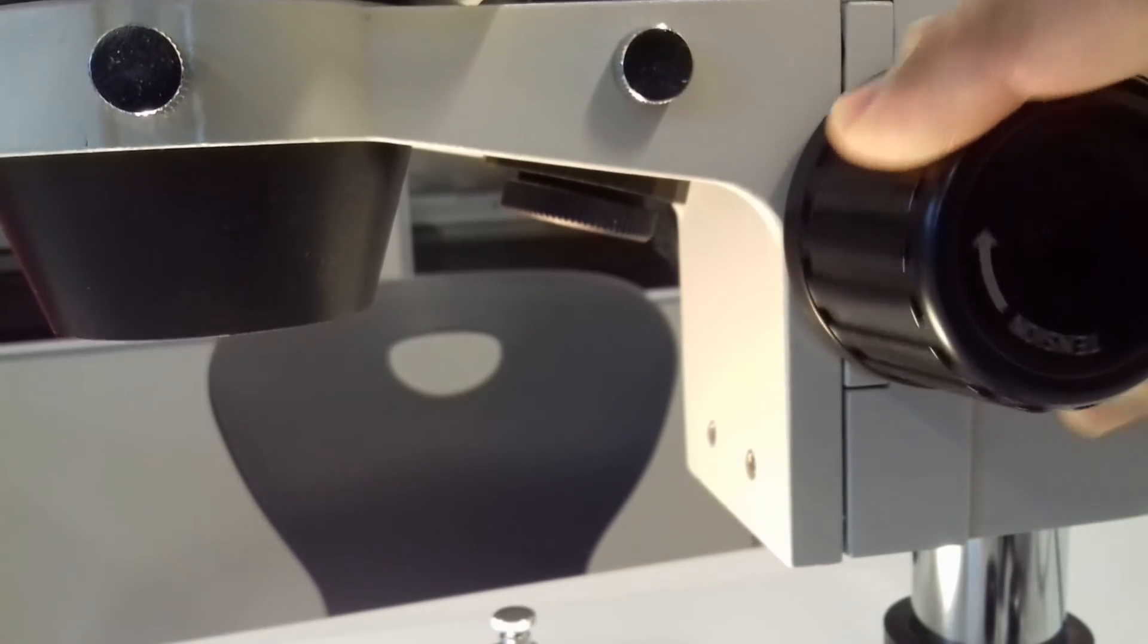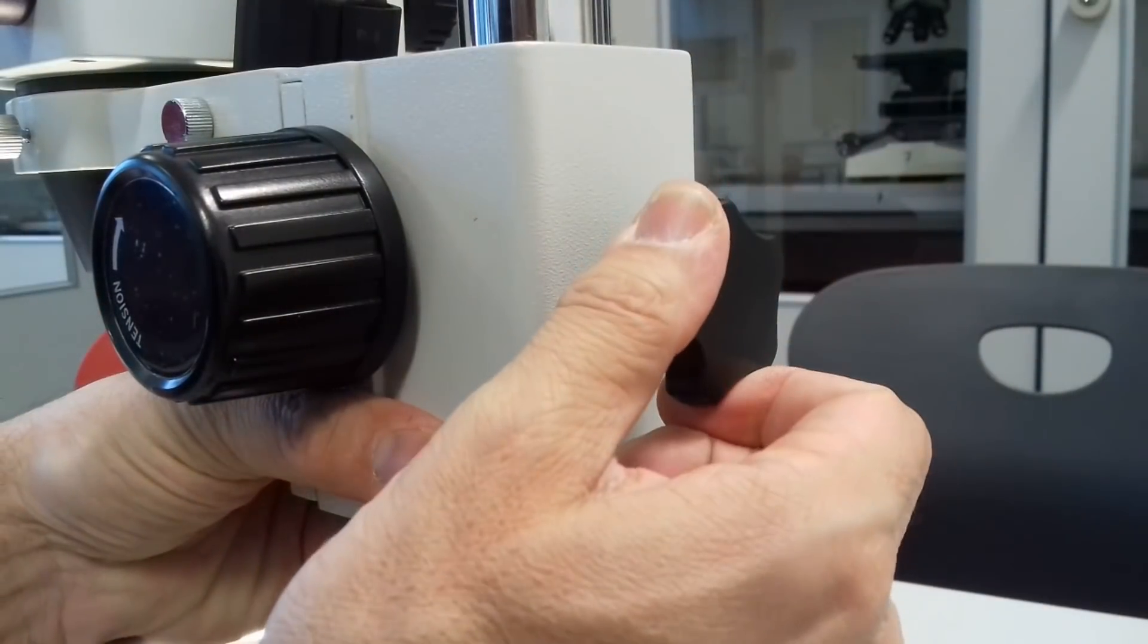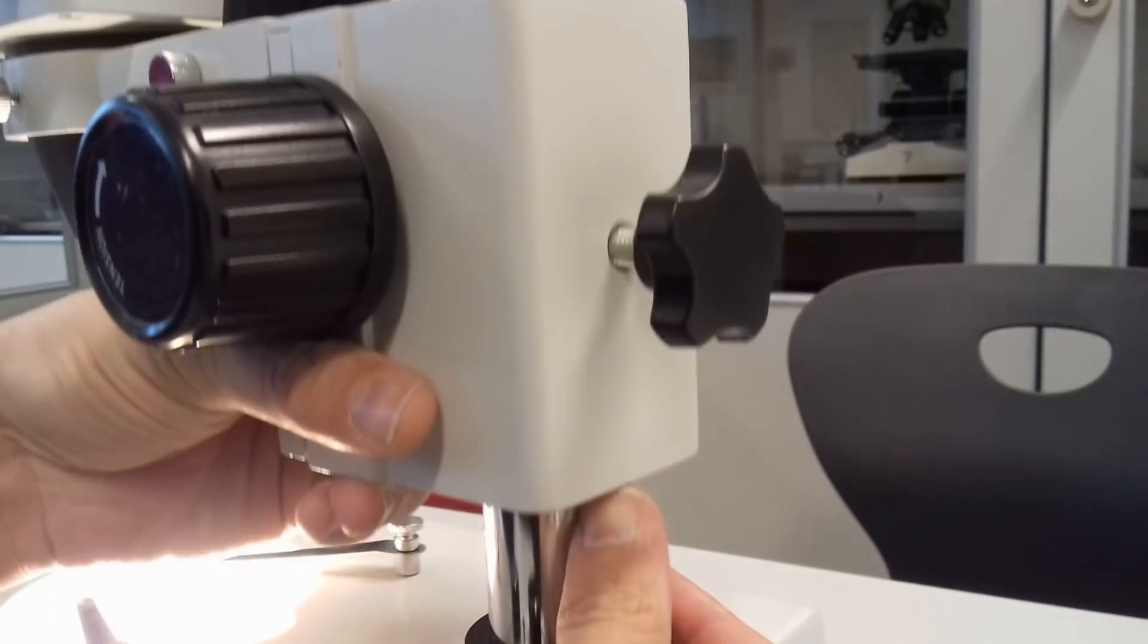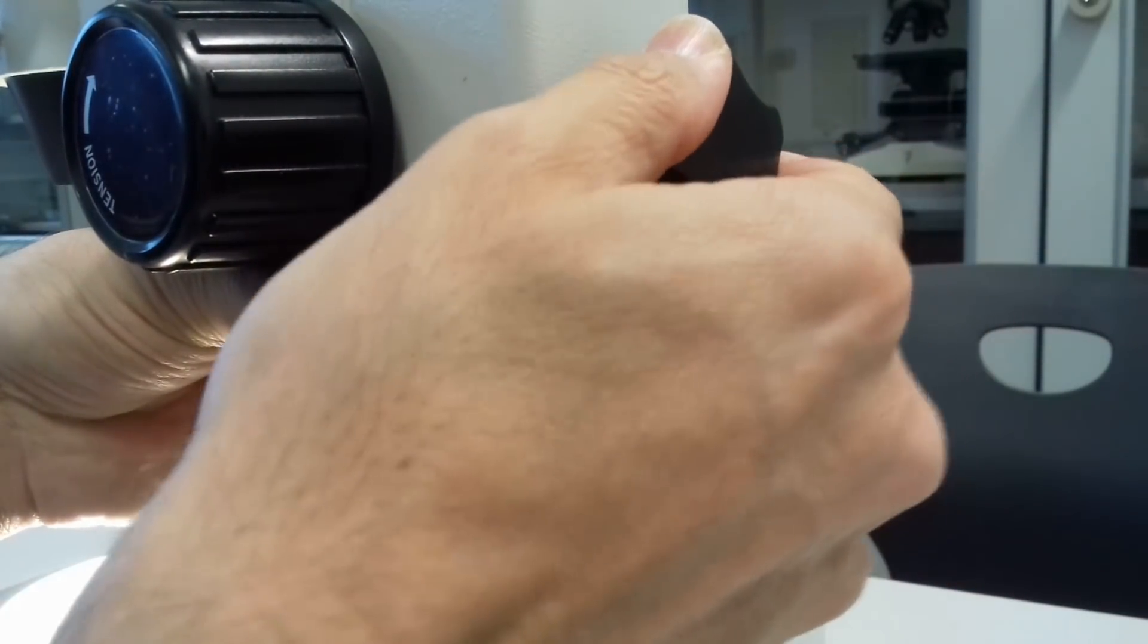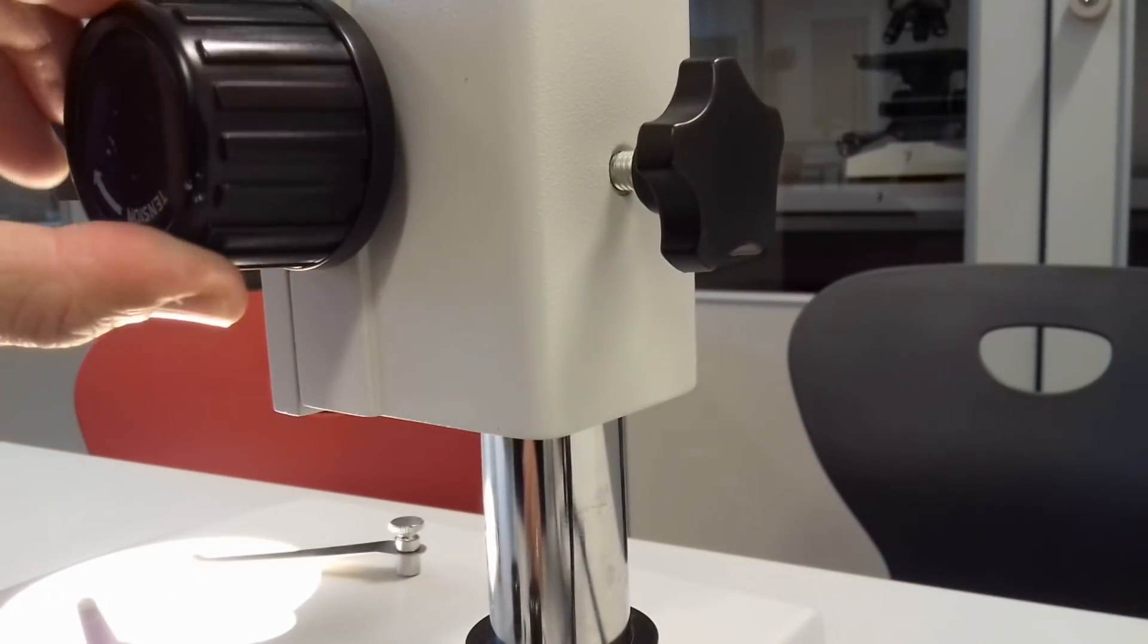That is the focus and as you can see when you turn the focus knob, then the whole head goes up and down. And if the distance is still not large enough, then you can also loosen a screw on the back and simply move everything up and down yet further.